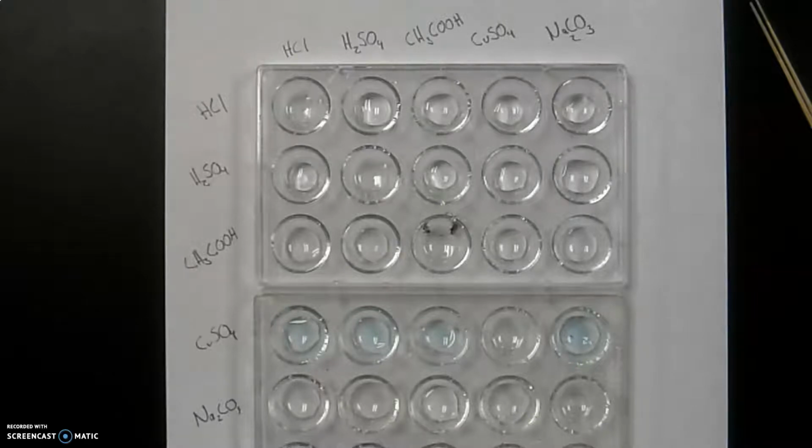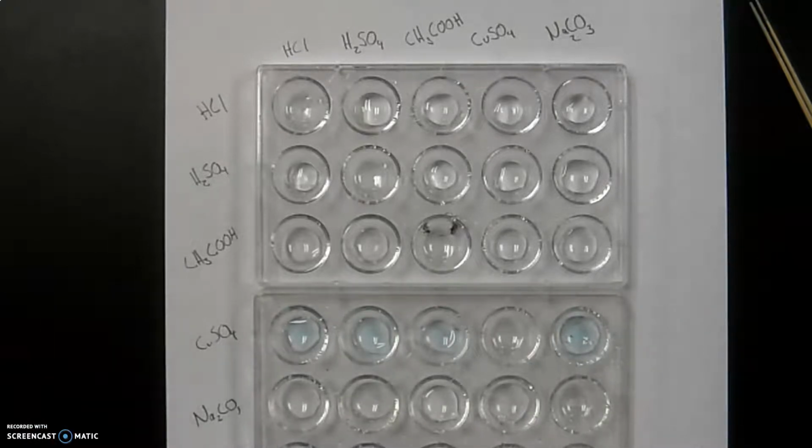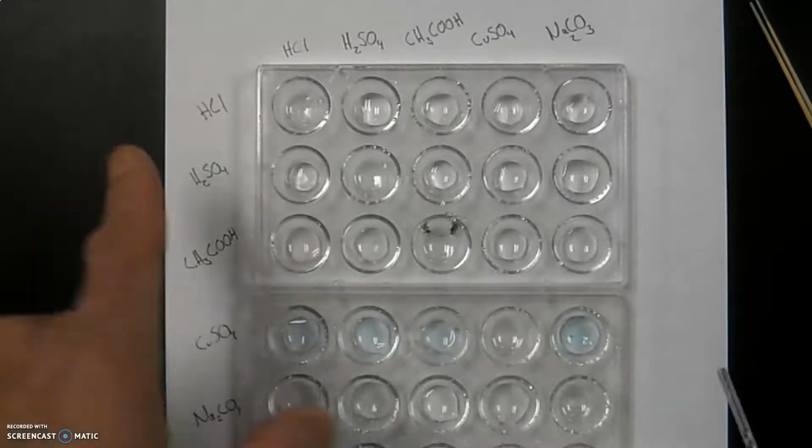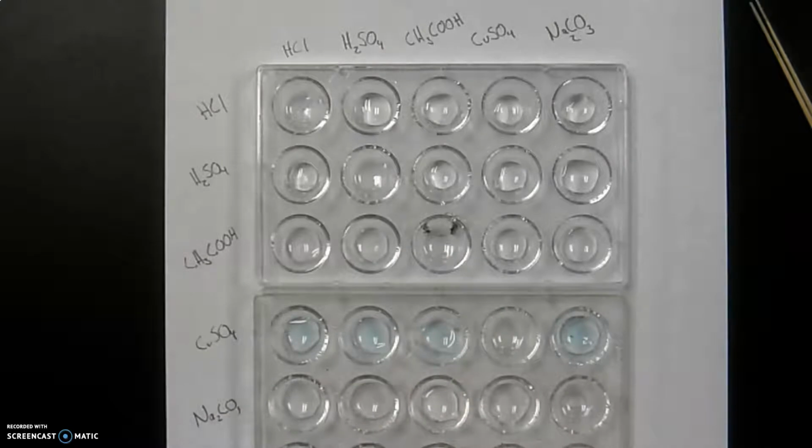Here is part 2 of the lab, and for this part we're just running the liquids that we had in the previous lab against each other to look for some potential reactions with these guys in comparison to each other. So the first one I'm going to set up is I've already kind of preloaded going across all the rows, and I did skip itself.